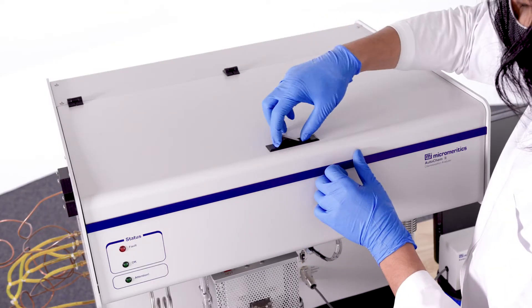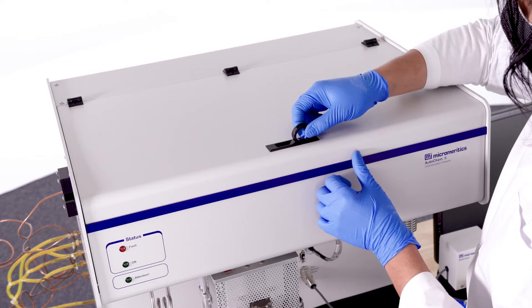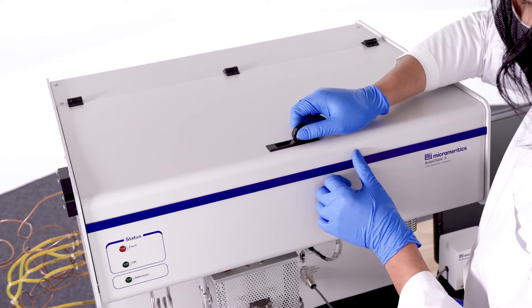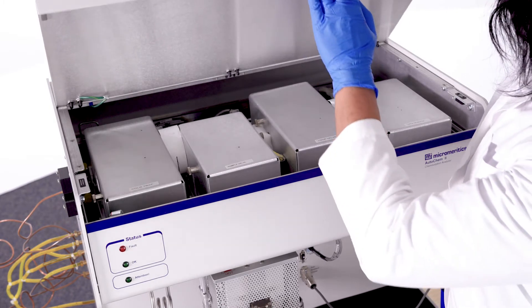Now on the instrument, press in on the right side of the retractable handle at the top of the analyzer to protrude the handle. Use the handle to open the hinge top panel.